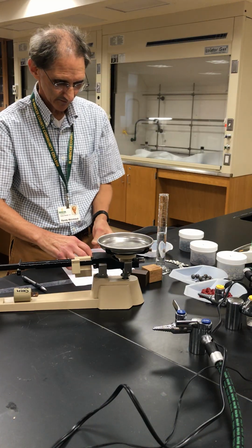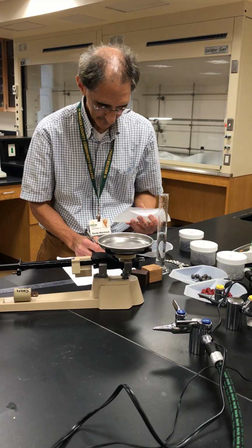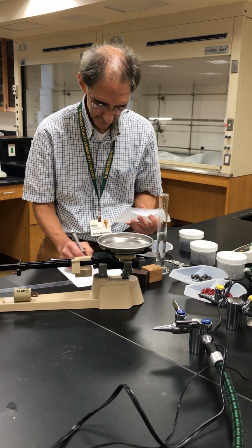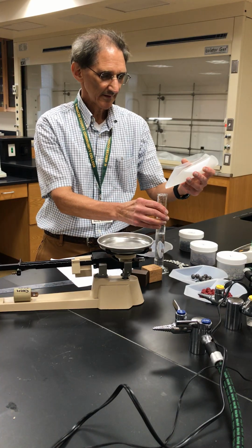I wrote that down. Now I want to put these in here.